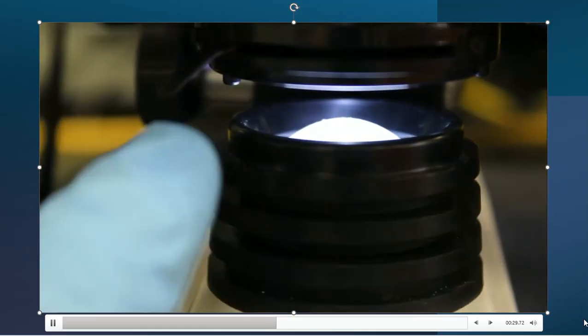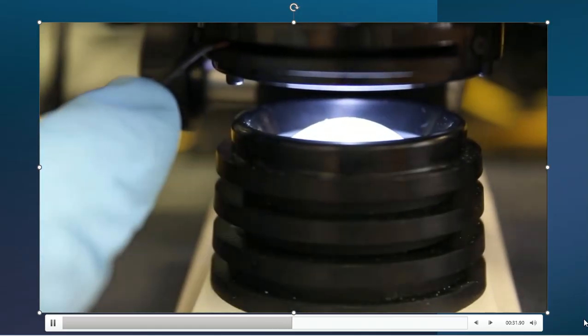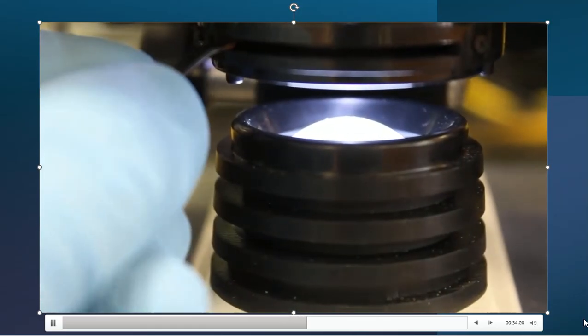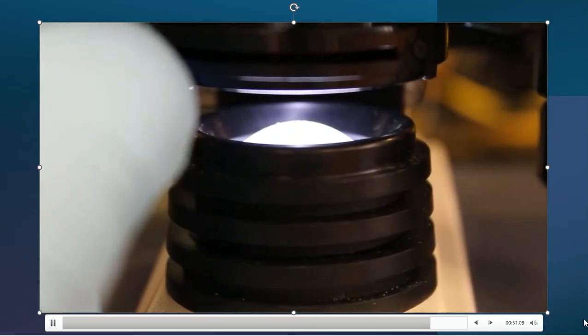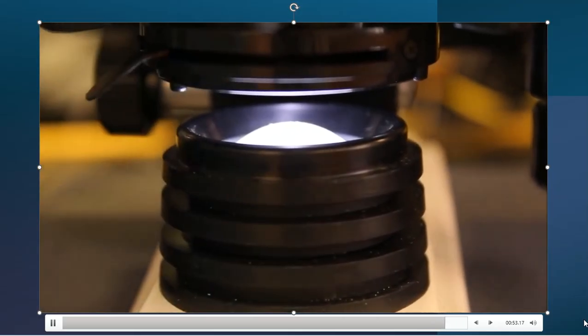So there's a small little lever that sits over here to the left-hand side, and I can grab a hold of this and twist that back and forth. And that will make the platform a smidge darker, and that way I can control it from here, almost like a fine adjustment tool if I want, versus the dial that's on the right-hand side of our microscopes, as you look at them at least.